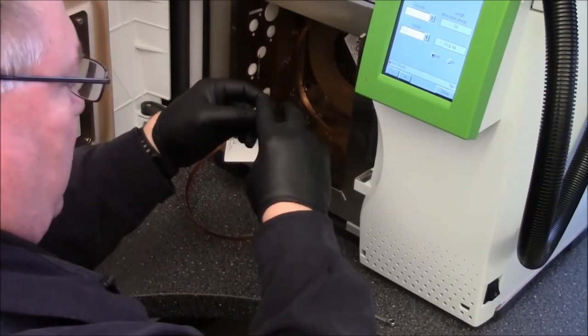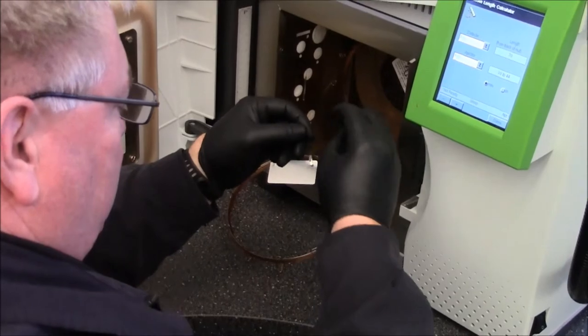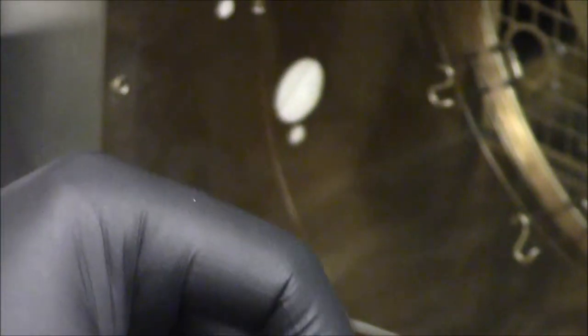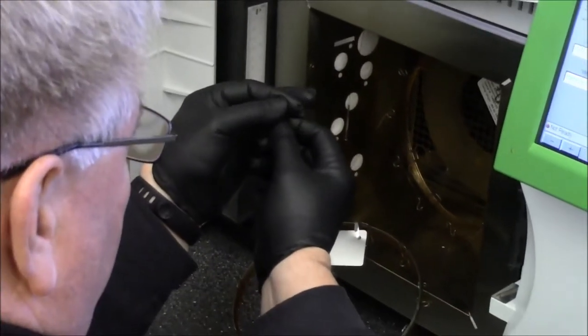So there's a rough edge on this and a smooth edge. After you've gone through all this stuff, there may be things on the very end of the column. So what you want to do is take and put this at a 45 degree angle and as square as you can to the column, just kind of score it and then flick it and it'll break off clean.